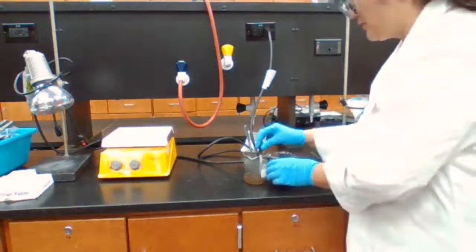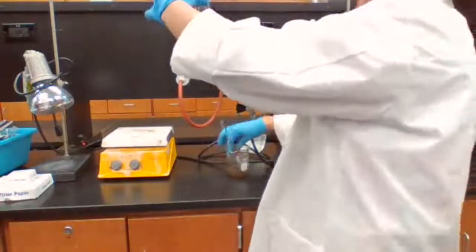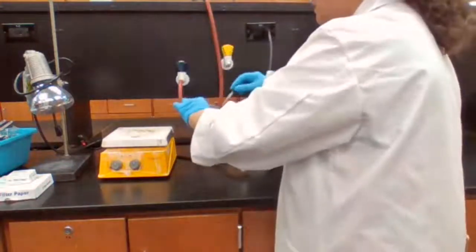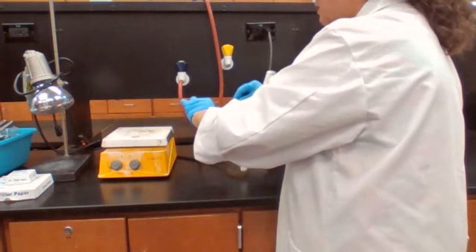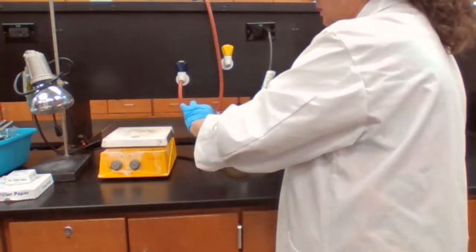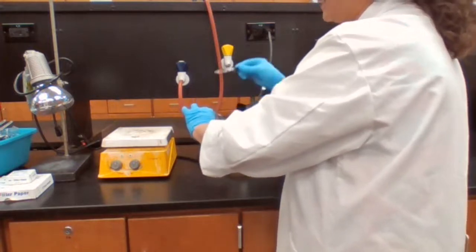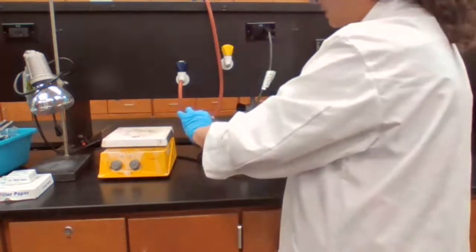Okay, enough. So to this mixture rather, not a solution, this mixture, trying to get as much clear solution out. So I changed my mind because I see a little bit more of a clear solution that I can get out.